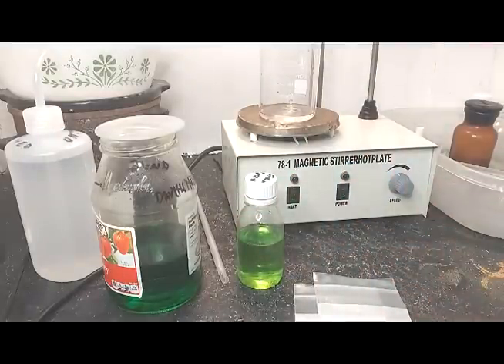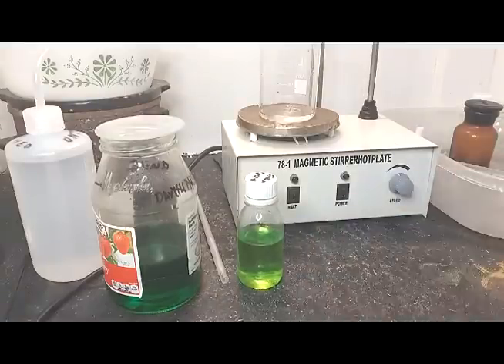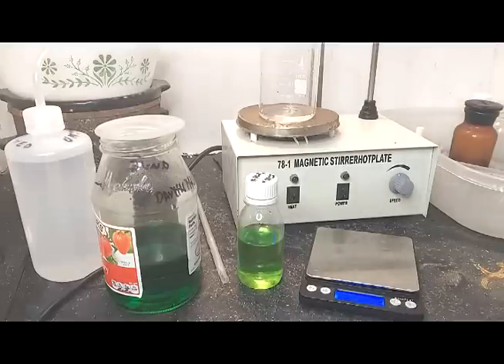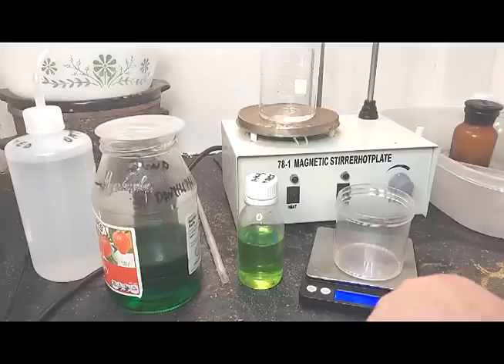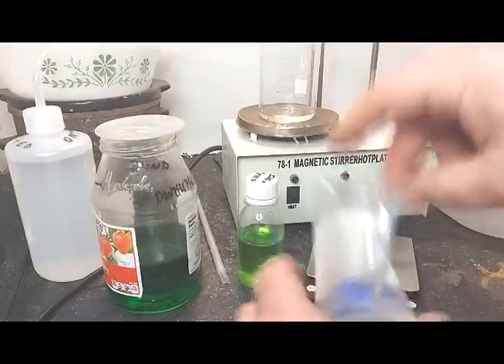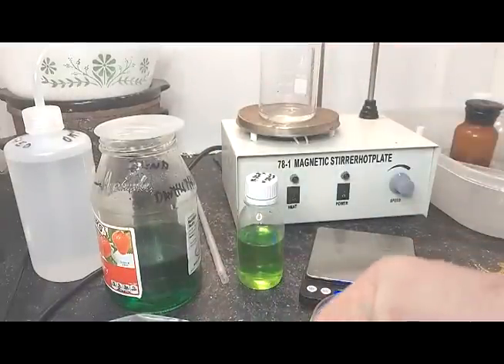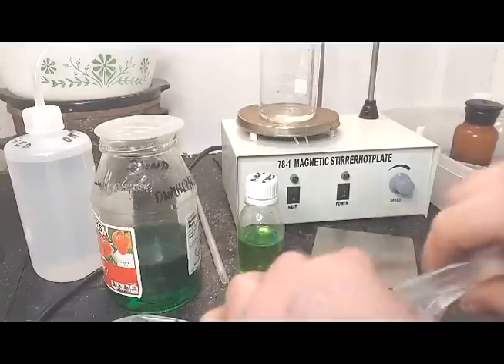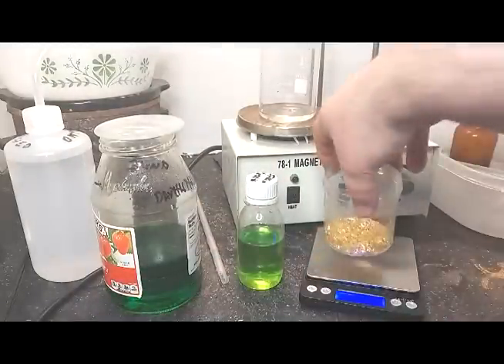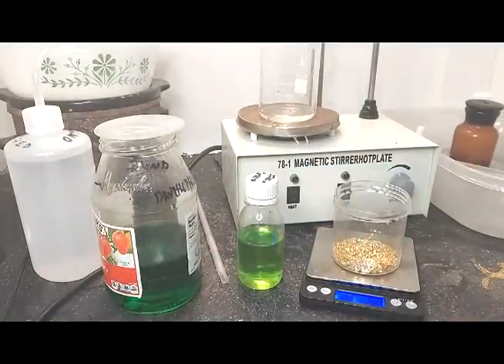I don't know why it wouldn't be good. We'll weigh out what we've got as far as the gold-plated items, but it's not much at all. I'm very skeptical that this is actually going to work. I was challenged — indirectly — that I could just use nitric acid for this. Why would I use this stuff? As we all know, we've got 37 grams of gold-plated, mil-spec items. That's not a lot at all.